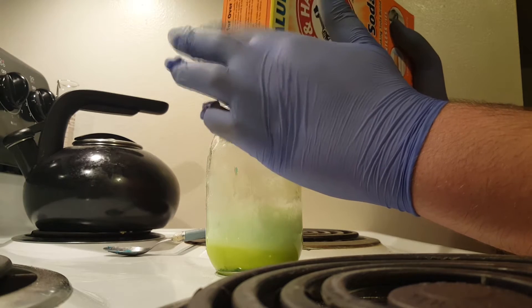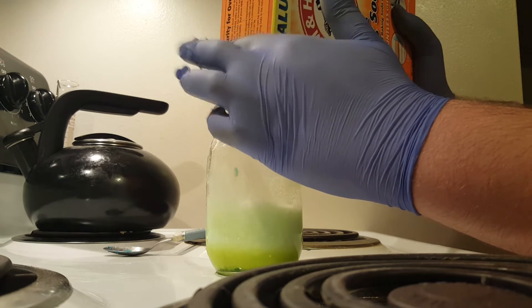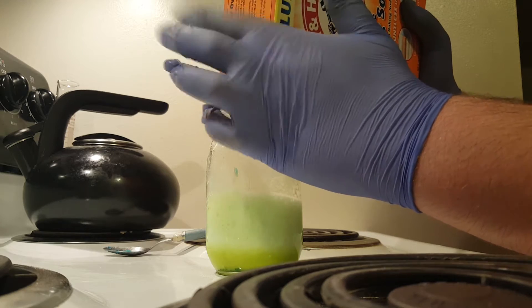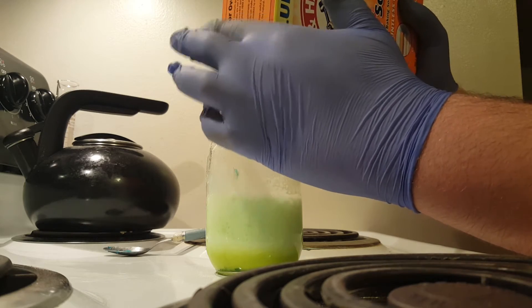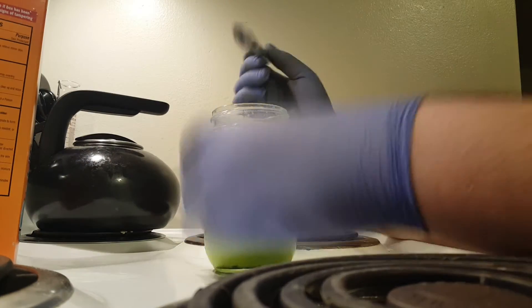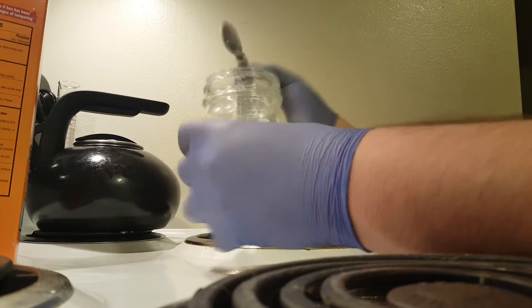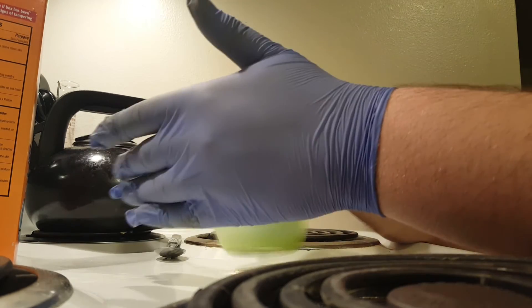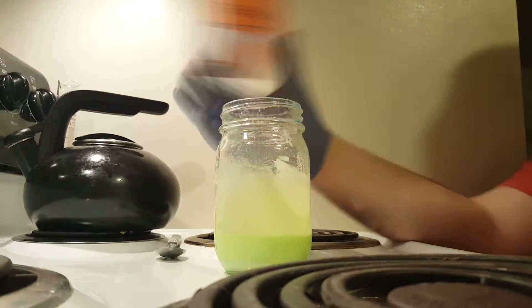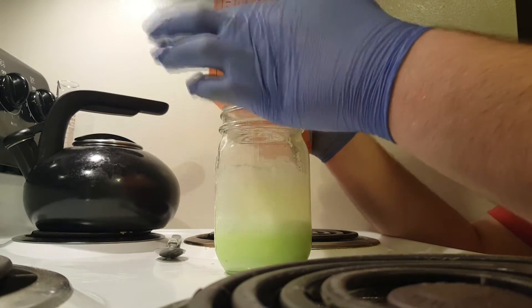It's a very beautiful sort of copper chemistry and stuff that I actually plan to explore later on this month. Now it is absolutely imperative that while you do this you have to stir slowly and slowly and get all those bubbles down. Another very important thing to note is that the entire reaction is quite endothermic, meaning that the glass and the entire solution becomes very cold. I would suggest not doing this in a metal container as it may stick to your hands and hurt your skin.